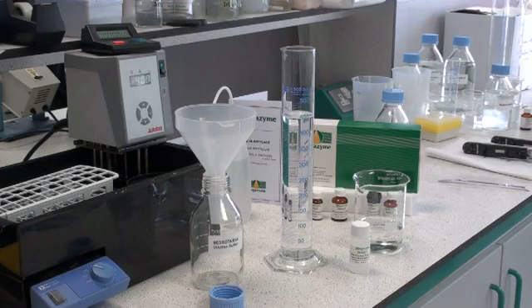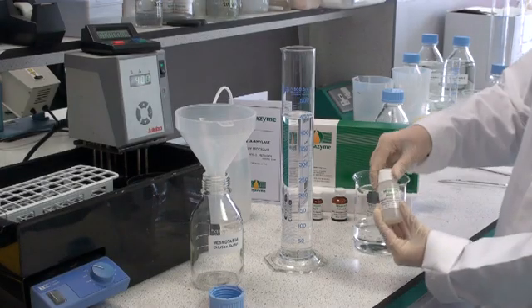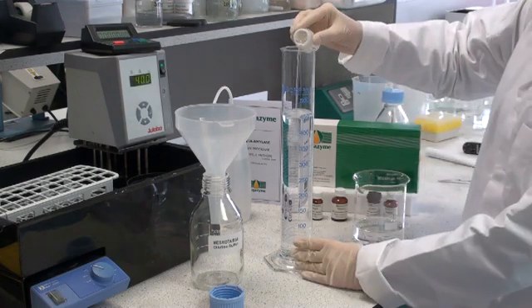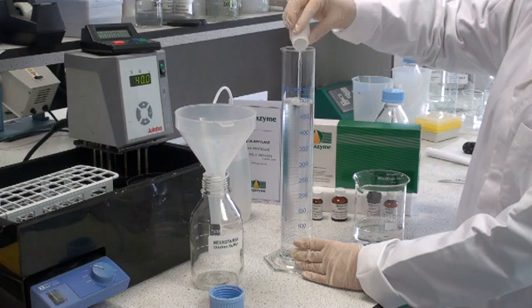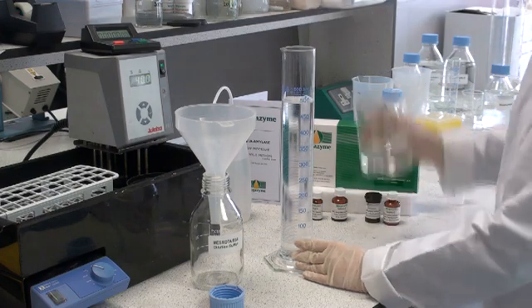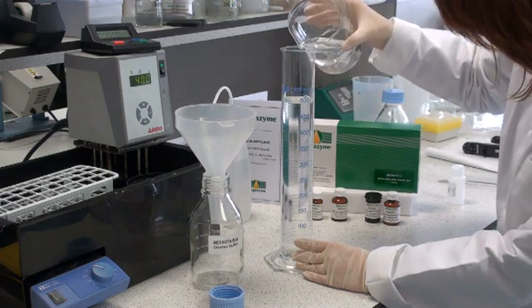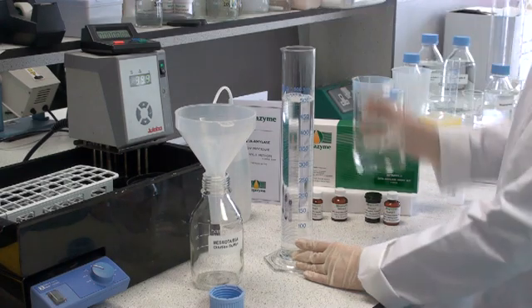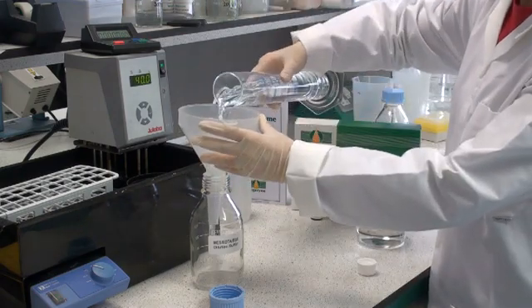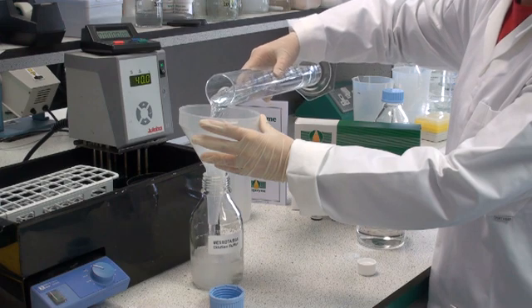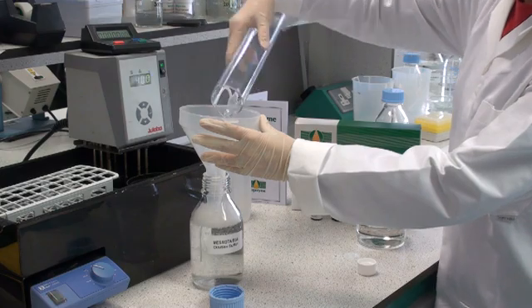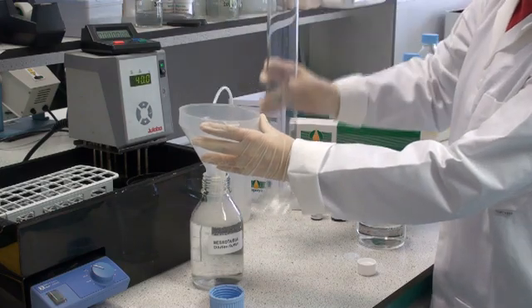Prepare the MES dilution buffer by adding the entire contents of container 3 to a measuring cylinder and adjusting the volume to 500ml. This is transferred to a 500ml Duran bottle and is stable at 4 degrees centigrade for approximately one year.